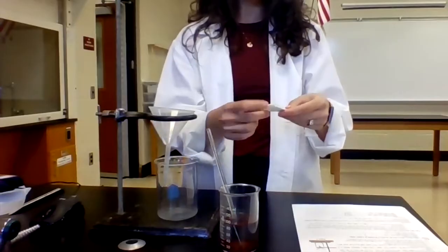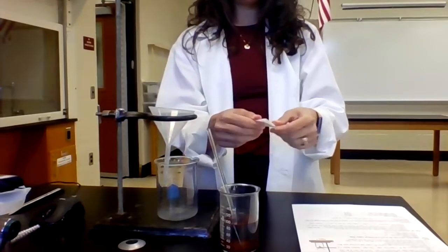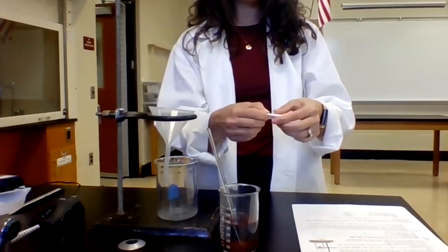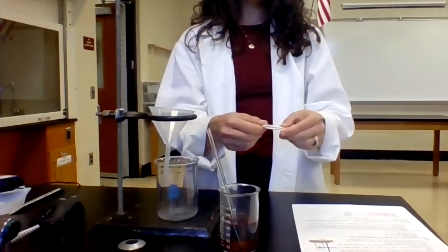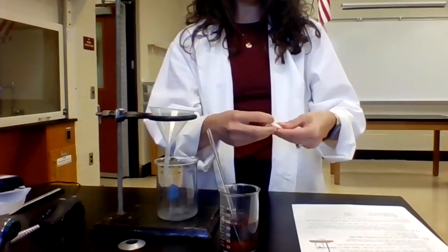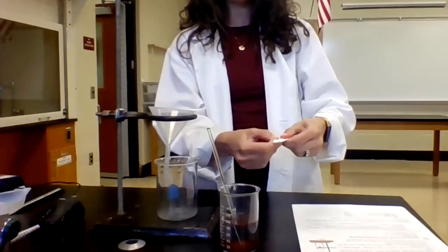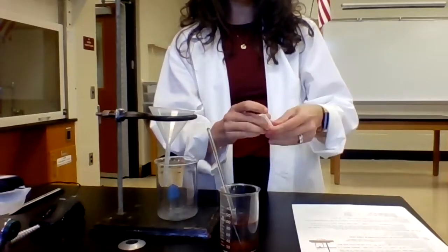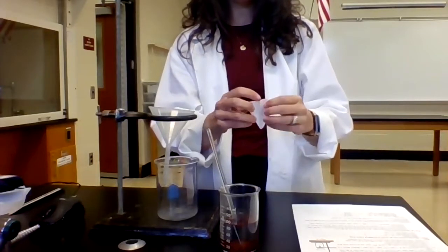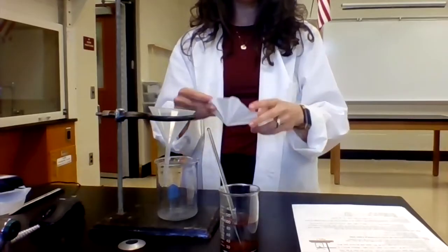I'm gonna do this one more time. It's normally all you can really get out of it. So again, fold this back. You can try to do it a third time. Doesn't always work super well because the paper at this point is pretty thick, but try to get a few more folds in there, like so. Okay, now we open it up and we have all of these nice folds for my product to stick to.